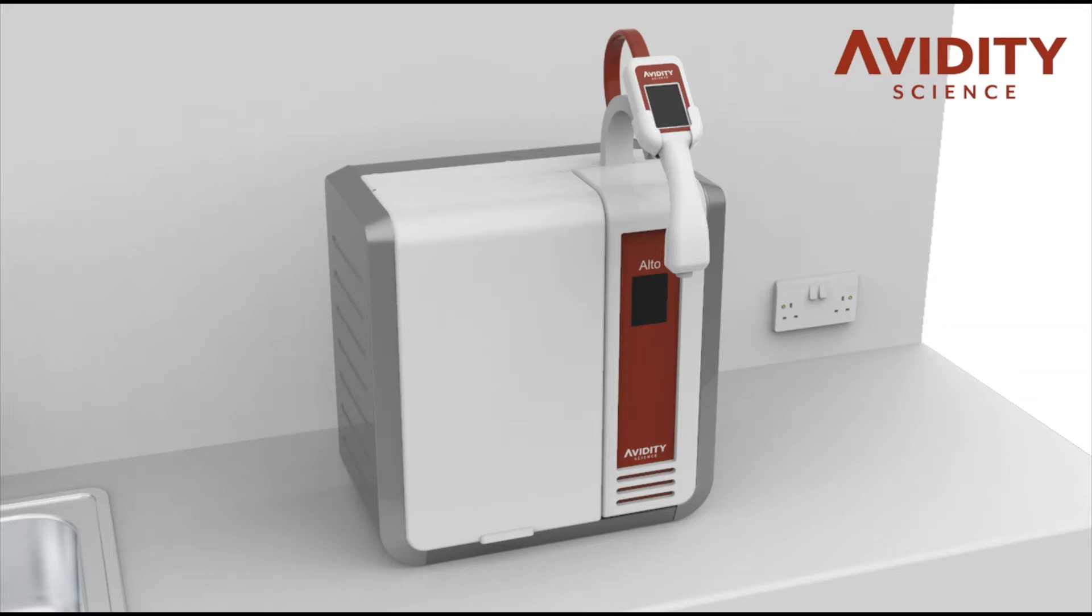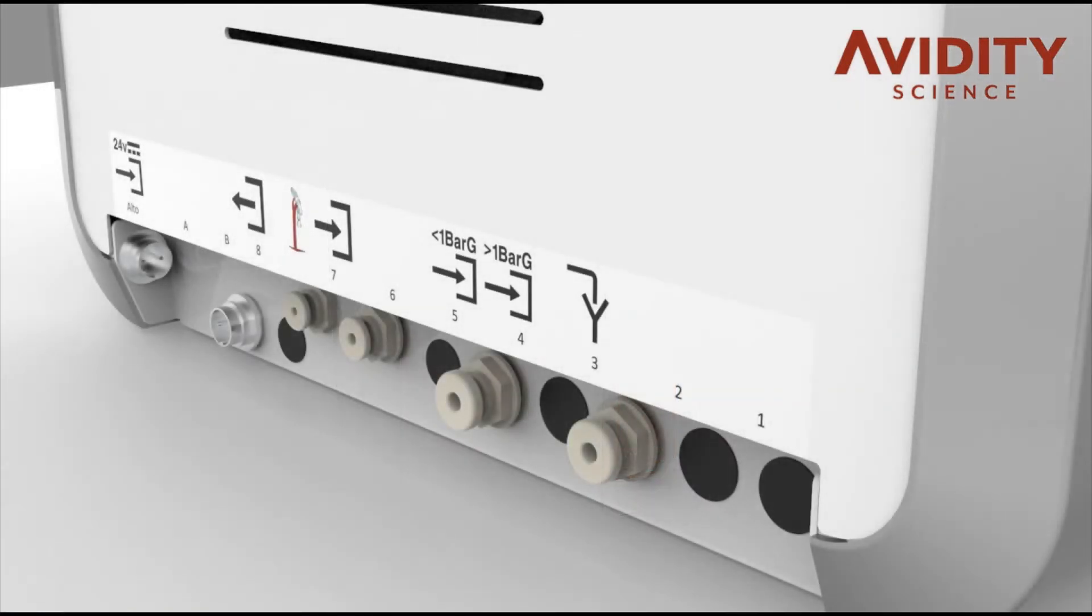Welcome to the installation guide for the AvidityScience Alto Type 1 Ultra Pure Water System.